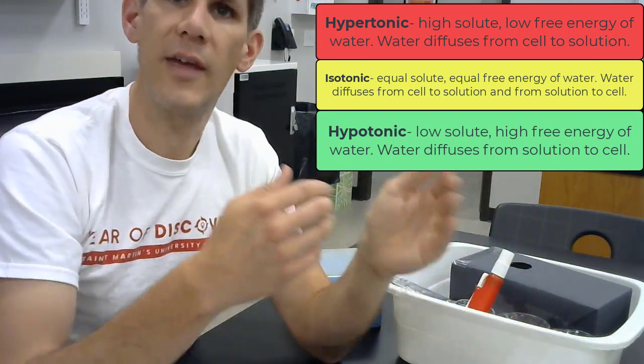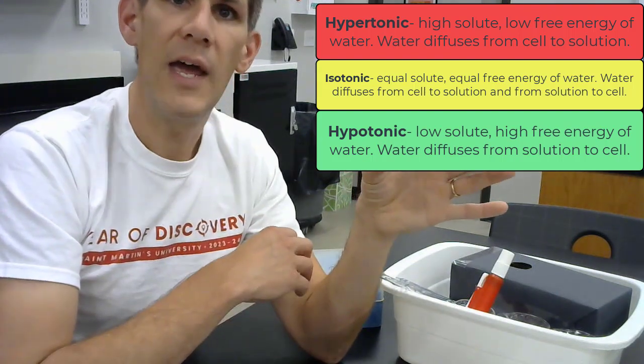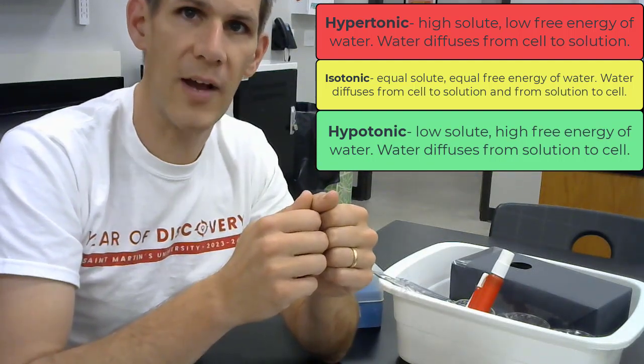And the last one is a hypotonic solution where there is less solute outside the cell than there are things inside the cell. This means the water has a higher free energy outside the cell, and water will move from the solution into the cell, and we can expect those potato cubes to grow in size.